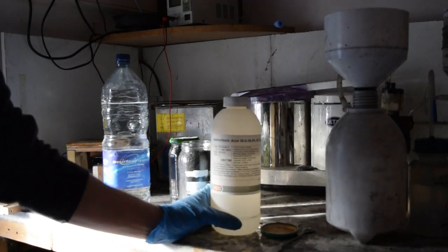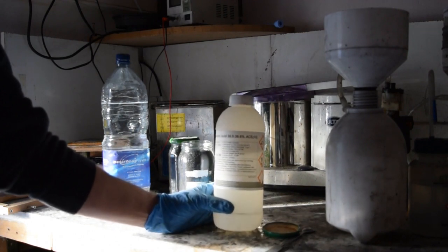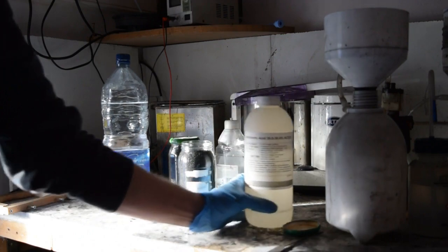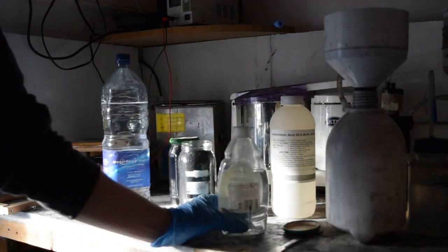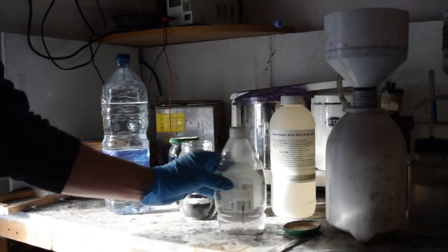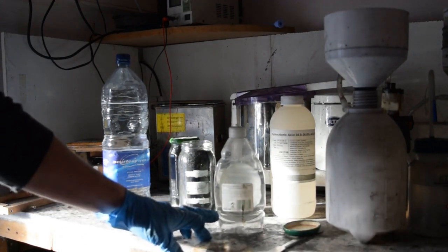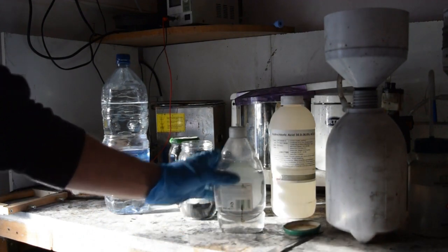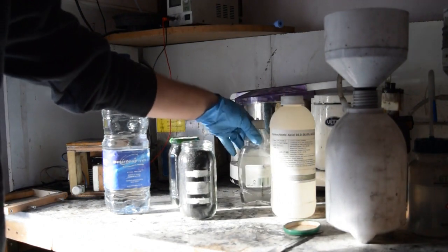The first thing we need to do is to wash out all of the metals. The way we do that is to use a dilute solution of hydrochloric acid. That's about 36% in there, so we need to dilute that down. I get this empty washing-up squeezy bottle and filled it to about a third with the hydrochloric acid and then about two-thirds with deionised water. So about 10% of hydrochloric acid in that squeezy bottle.